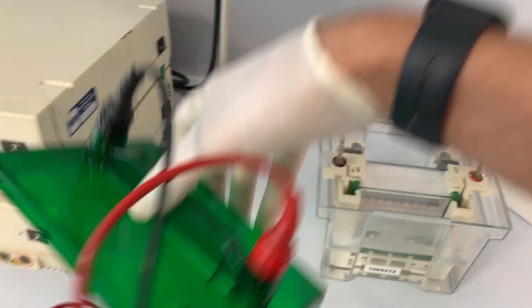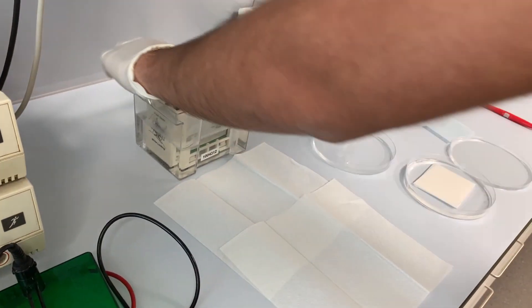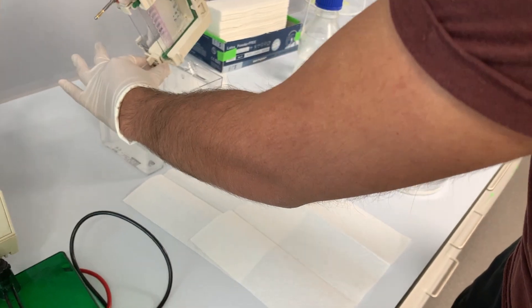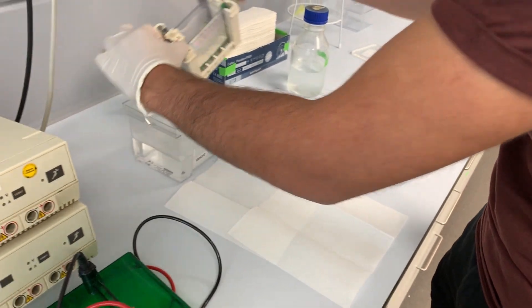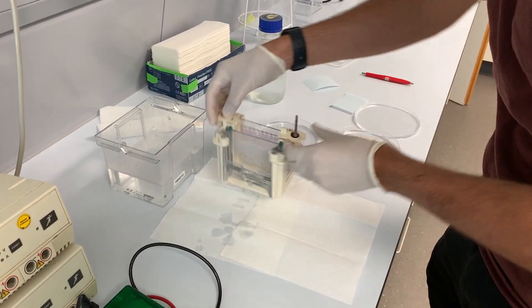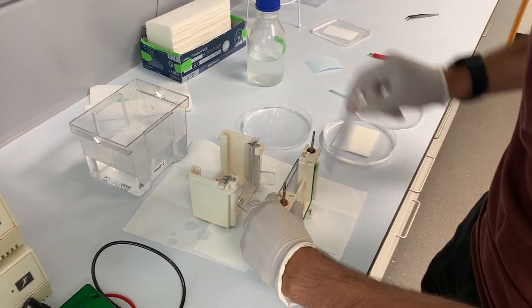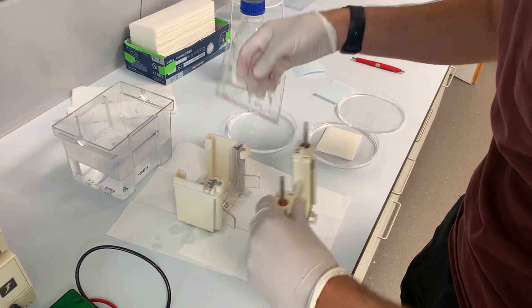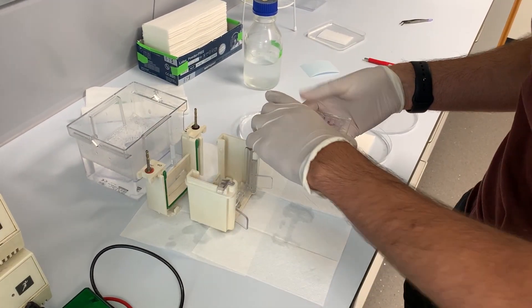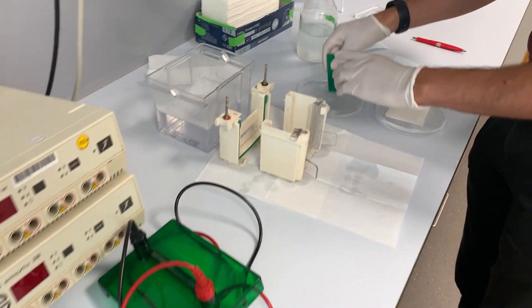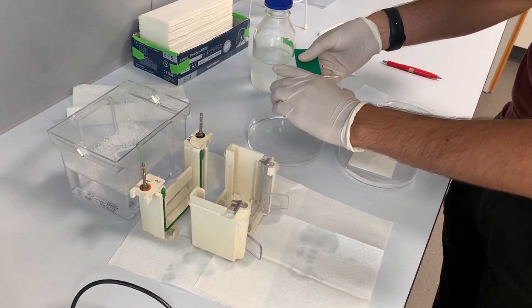Next, I take the SDS gel and incubate it in transfer buffer. I use a pre-wetted spatula and I remove very carefully the gel from the glass.